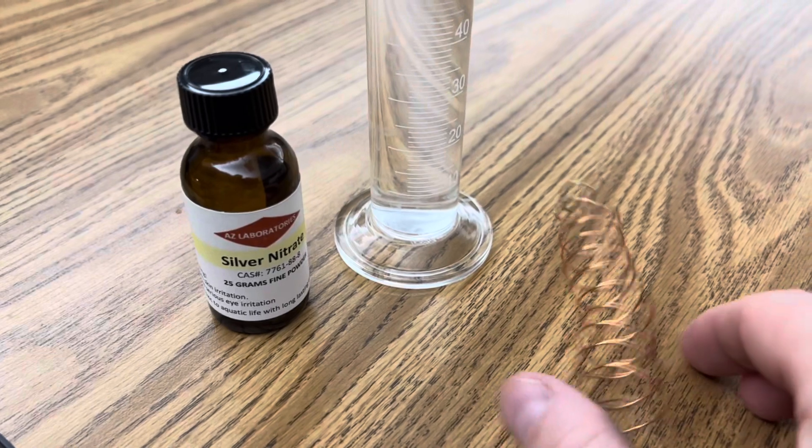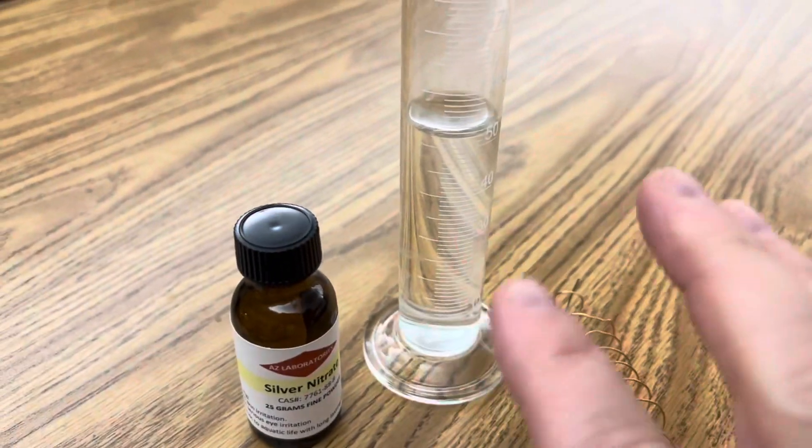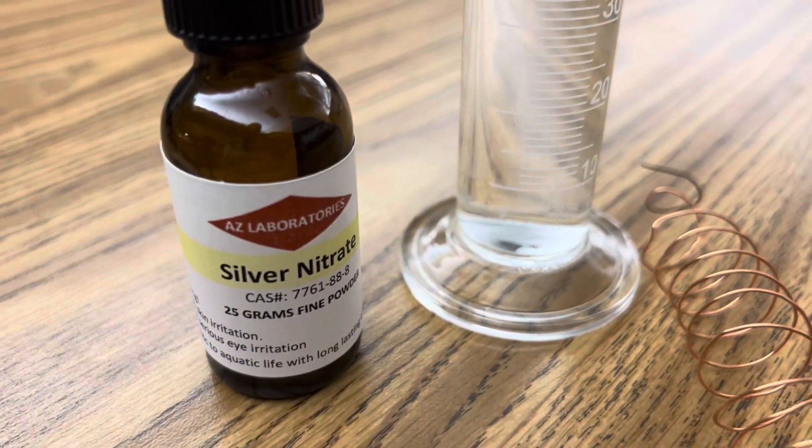All you need for this reaction is just some copper wire, a graduated cylinder with some distilled water, and silver nitrate.